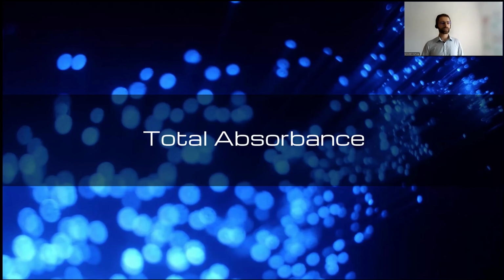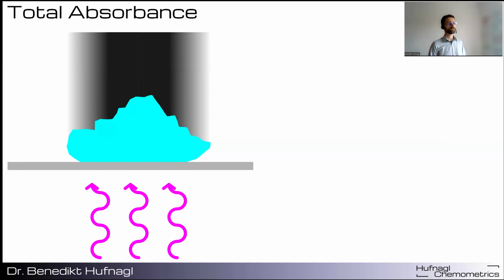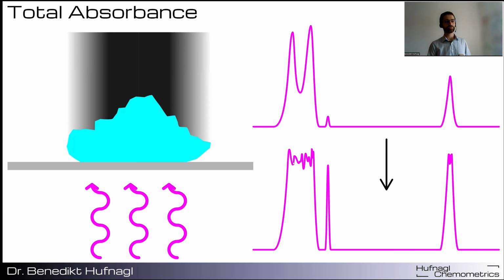So now let's have a look at the main topic of this presentation, the physical effects that can be problematic when analyzing micro-FTIR data, total absorbance. So total absorbance happens if we push our devices to the upper size limit of particles. And what happens here is that the illuminating radiation that passes through the particle in transmission mode gets absorbed by the particle. So here is an artificial spectrum that you can see here. And if this spectrum suffers from total absorbance, what happens is that the peaks get cut off here and here, for example. But we will also see that these peaks, they get, of course, larger, the smaller ones.